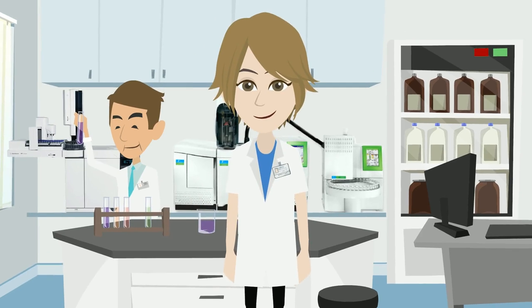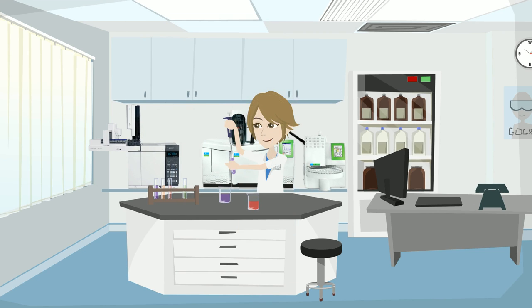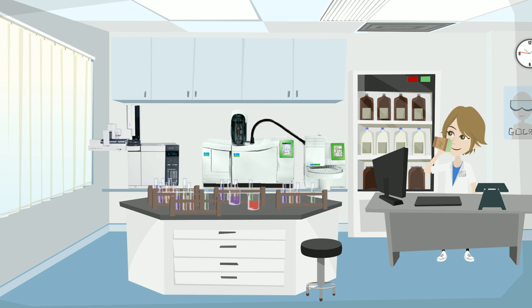This is Sarah. Sarah is a fragrance analyst and she loves her job. She uses GC-FID and GC-MS chromatographs to control essential oils, raw materials and perfumes. Each day, she has to control 30 to 60 products with complex chromatograms containing dozens to hundreds of peaks.